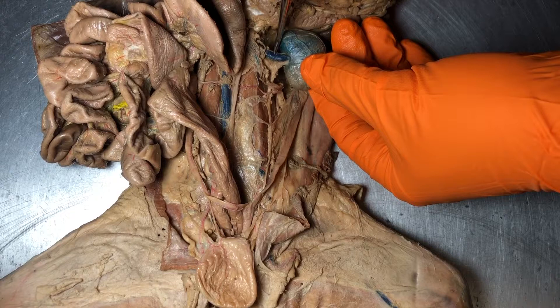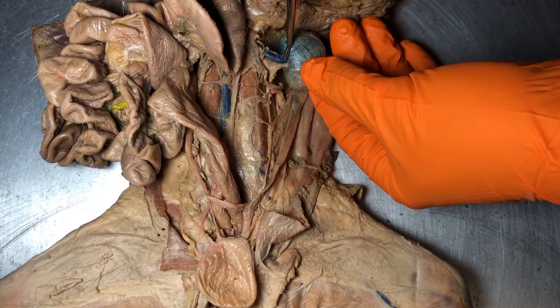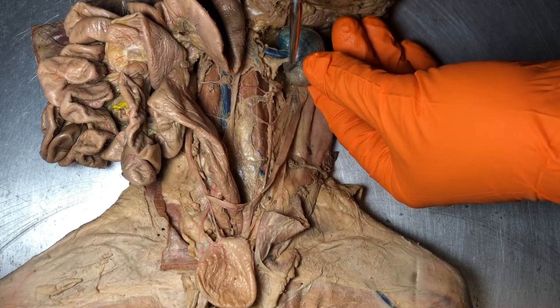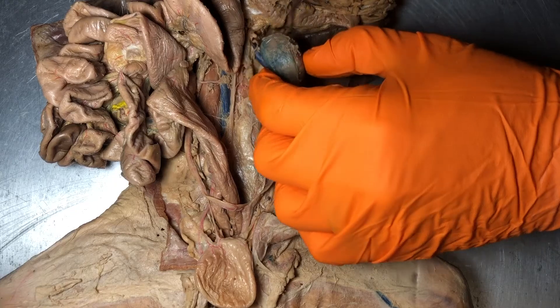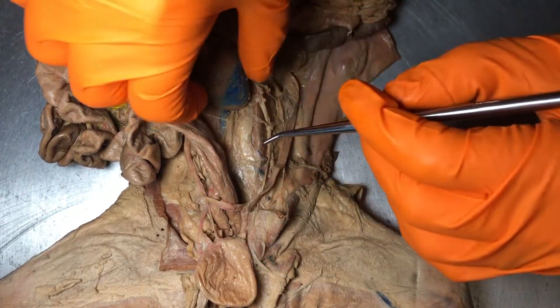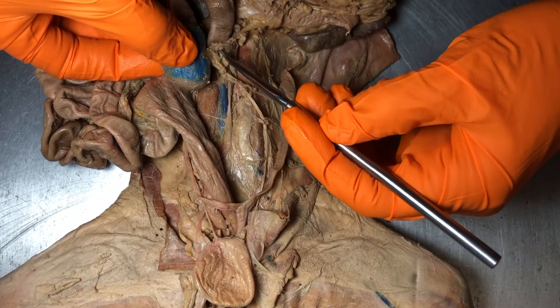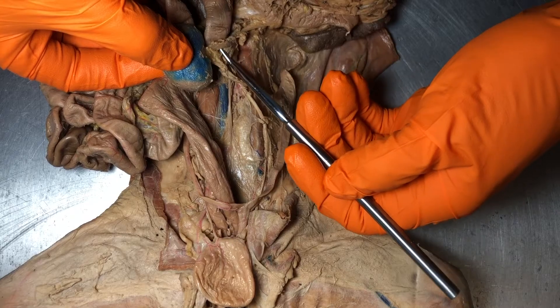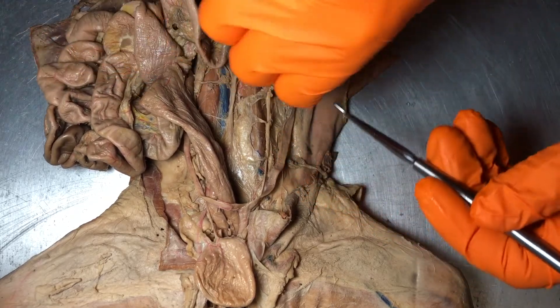So this would be the left renal vein, this is going to be the left ureter — we'll come back to the ureters in a little bit — and the renal artery is going to be better visualized on the posterior side. You see me retracting it like this; that right there is going to be the left renal artery.